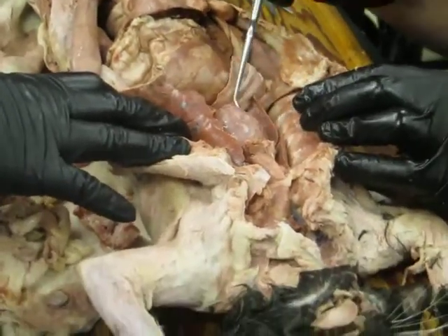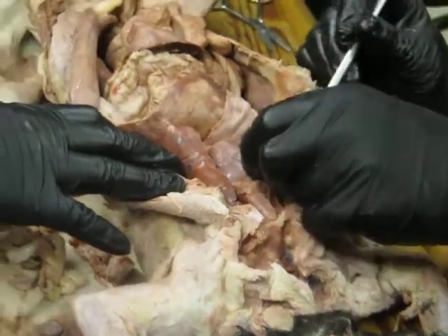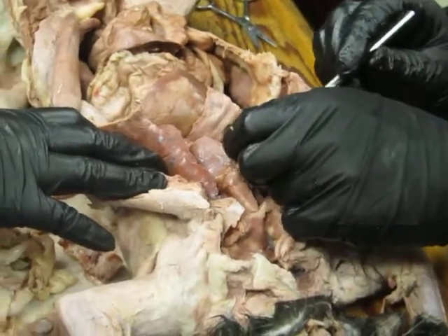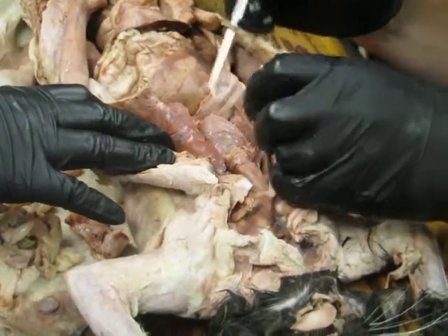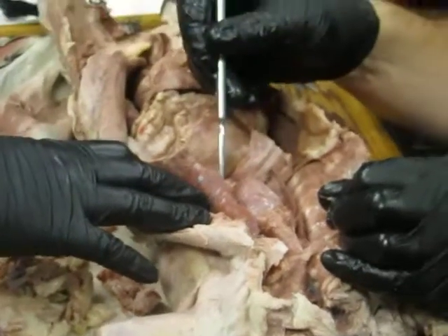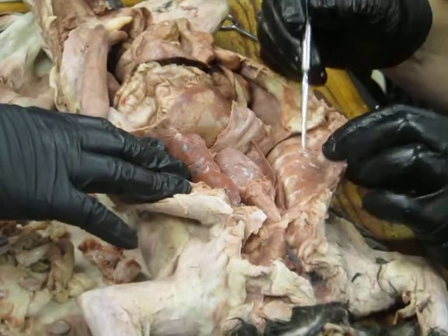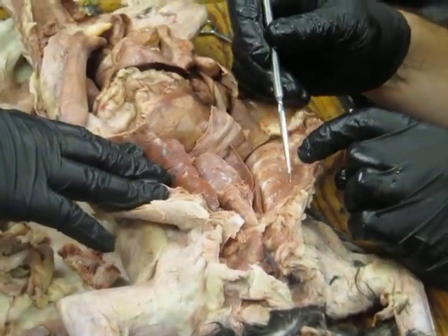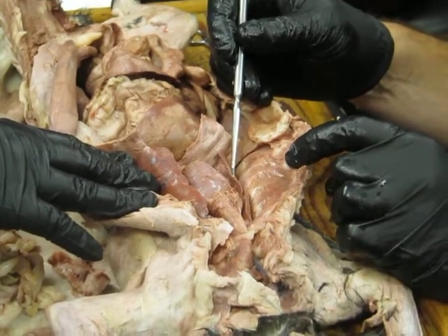Heart. What's the cavity the heart sits in? Pericardial cavity, excellent. So I can put my probe in there with any luck in the pericardial cavity. I actually have to pierce it, which is not... Okay, we'll leave it for now. The cavities on either side, though, those where the lungs are would be pleural cavities. And that membrane that lines the pleural cavities is the pleura. So this is parietal pleura. And then if I touch the lung, we're touching visceral pleura.